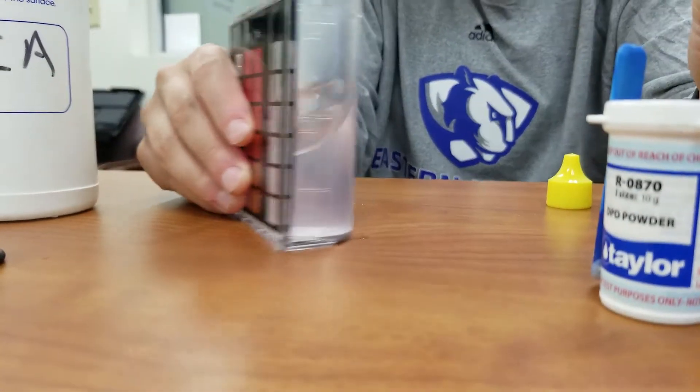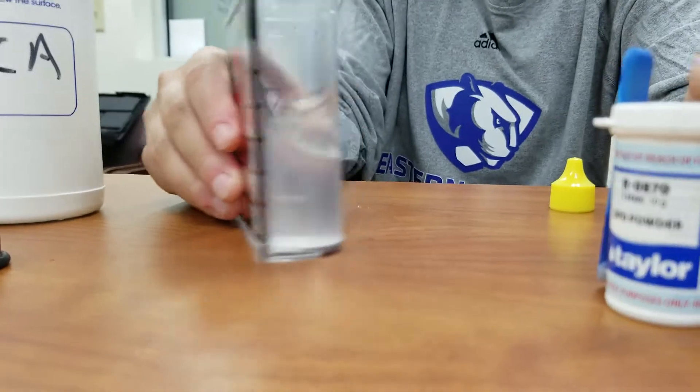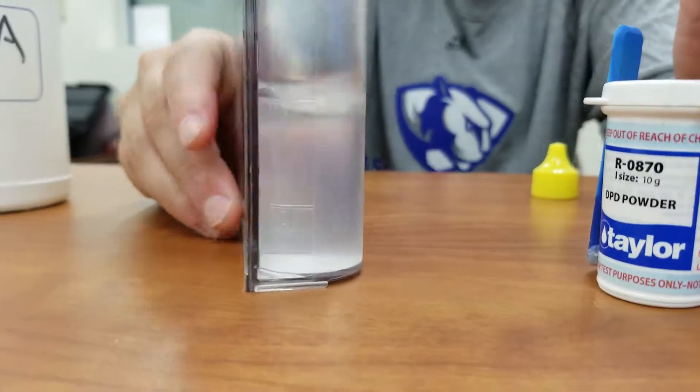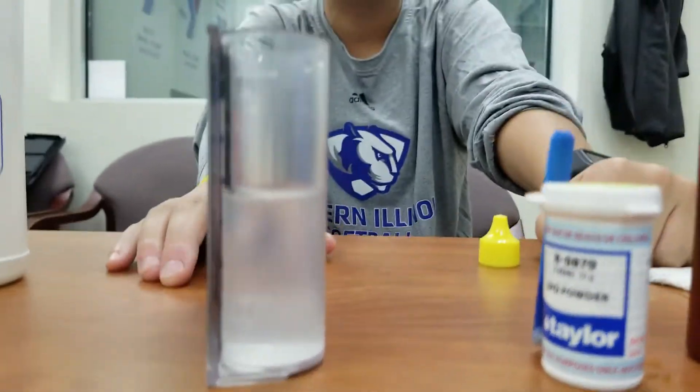We're going to add one more just to make sure. There we go. That's what we're looking for. So I added 15 drops.